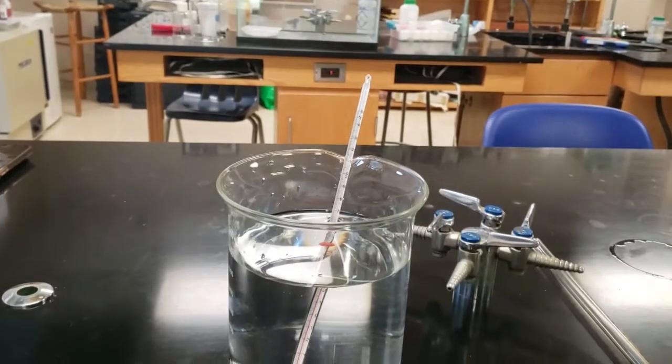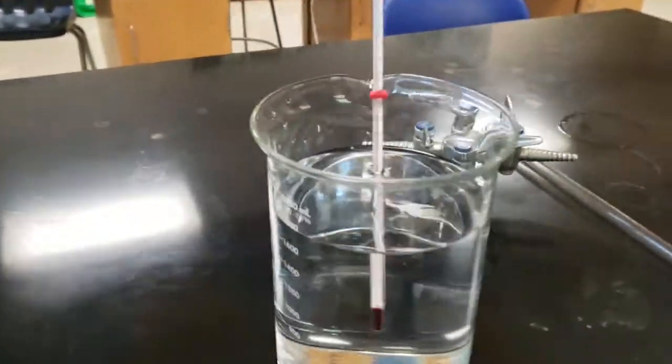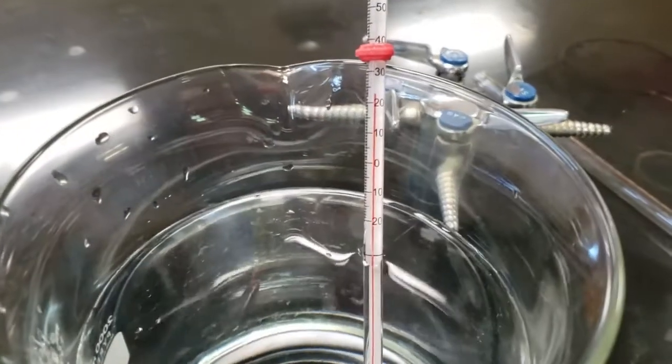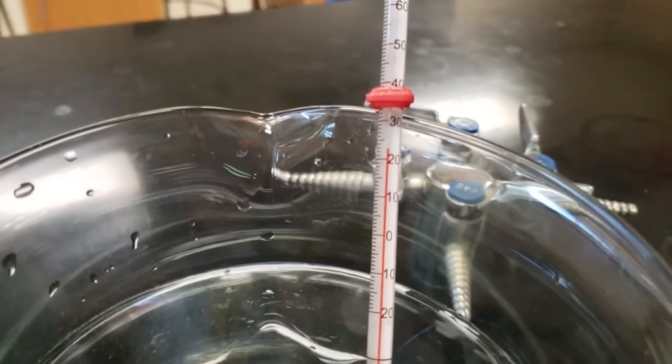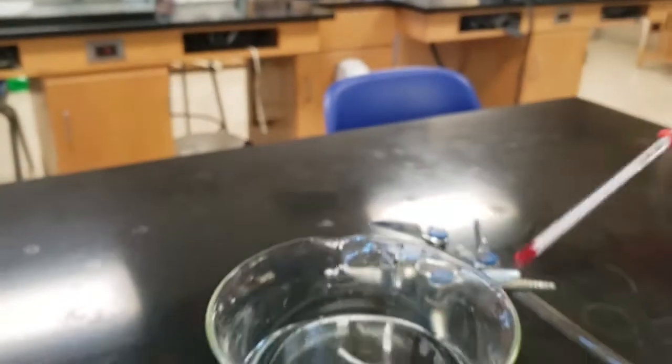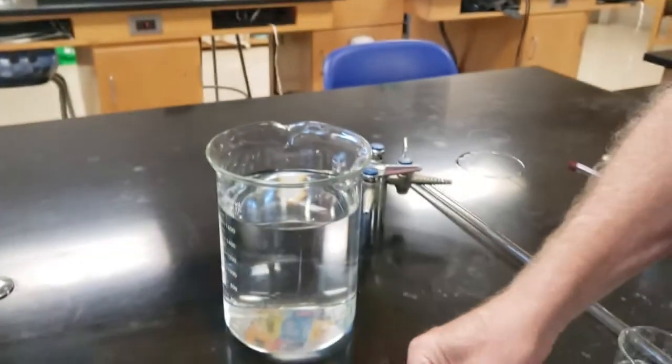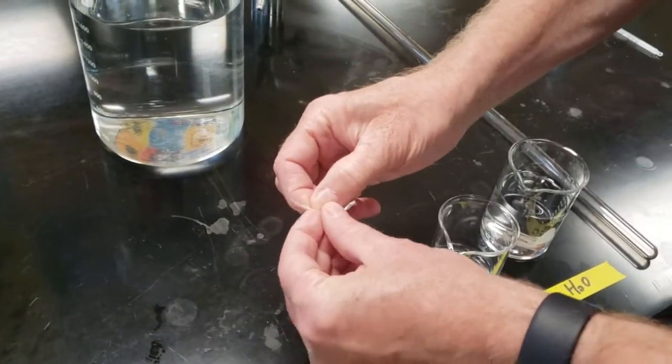We'll need about 50 milliliters of tap water. This glass tube is called a eudiometer tube. You're going to have a big beaker of water that's nearly filled and a thermometer in it. We need to record the temperature of the water. We're assuming the temperature of the water is the temperature of the gas. That thermometer reads to about the half of the degree Celsius, so your temperature should end with a zero or a five.